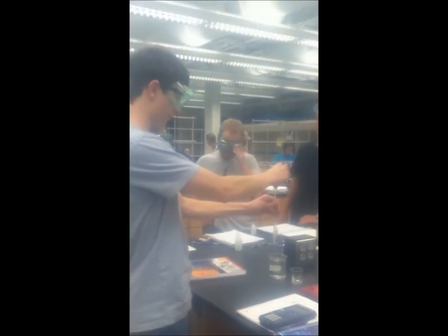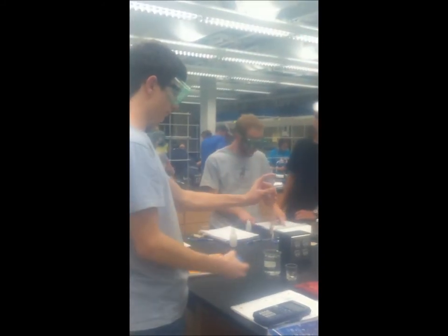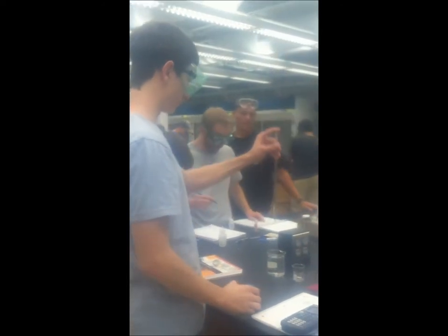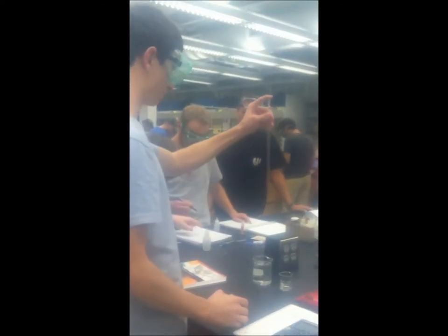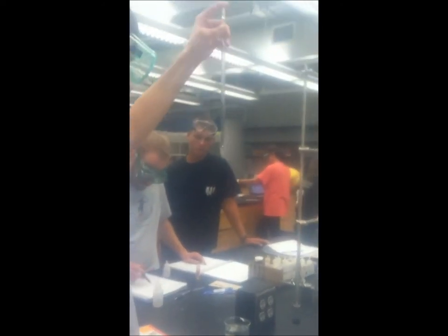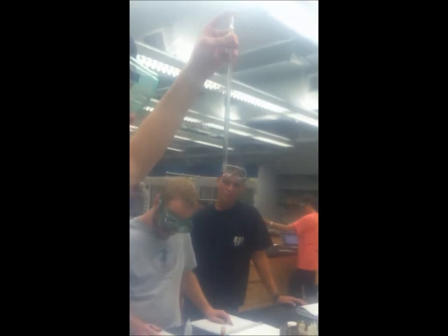Up next is myself. Once again, the first thing I do is draw water out of the beaker with the pipette. Once I have an unknown volume of water in the pipette, I will then get the measurement from the bottom of the meniscus and record it in the initial volume spot on my chart.